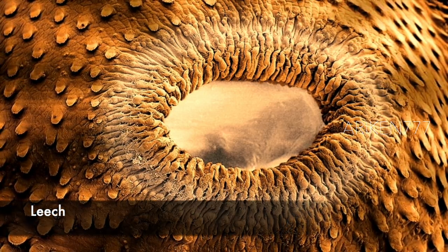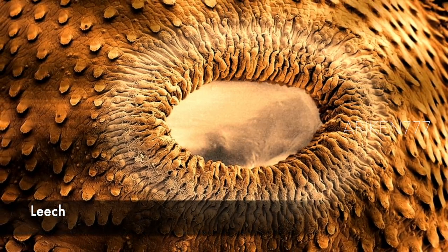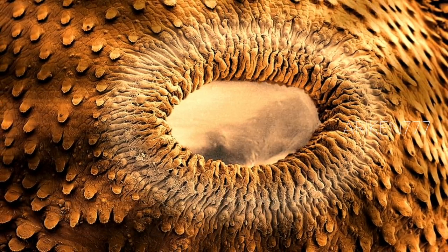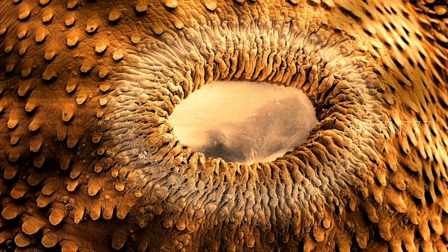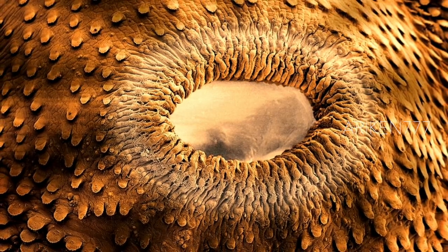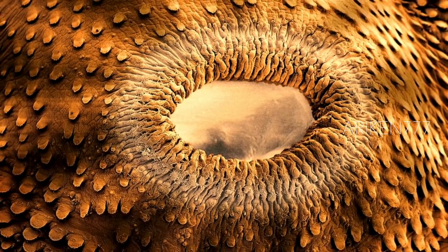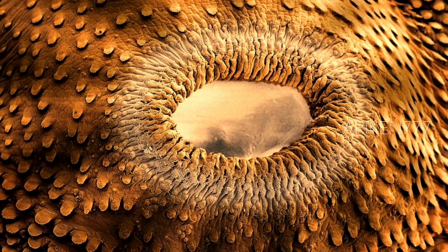The sucker of a leech. These blood-sucking parasites have two suckers, one at each end of their body, which they use to attach themselves to the victim's skin while drinking their blood.